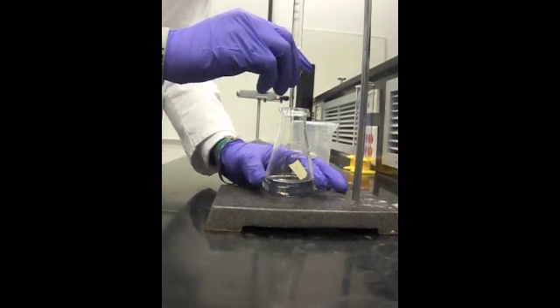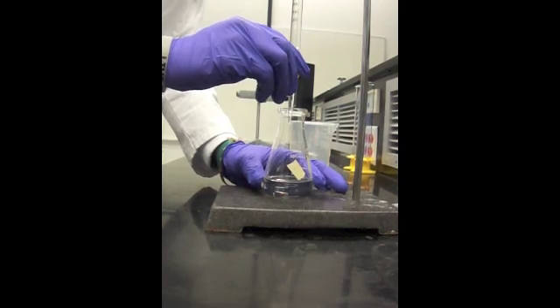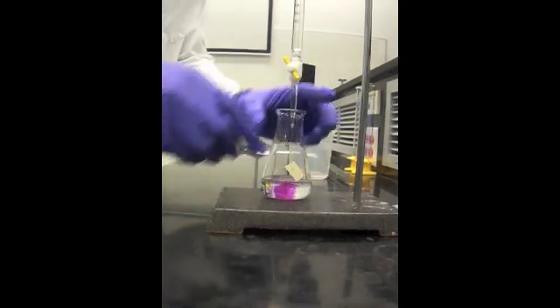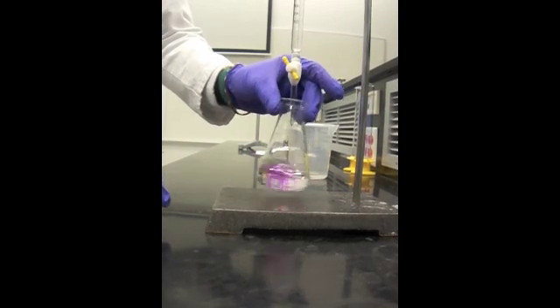When you're doing this, you want to take your time because if you go too fast, it can turn a dark pink color at any moment. It's very smart to go drop by drop. You can even let it go and just swirl it around as the solution is dropping in.